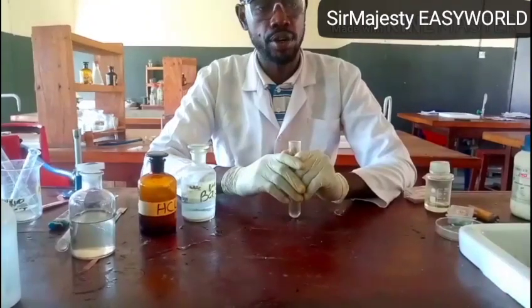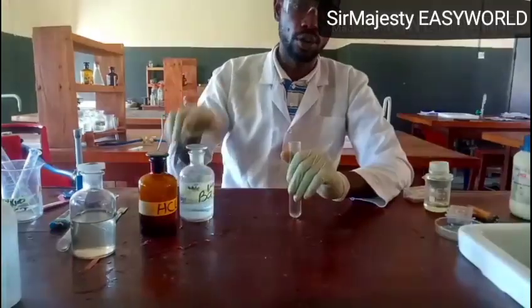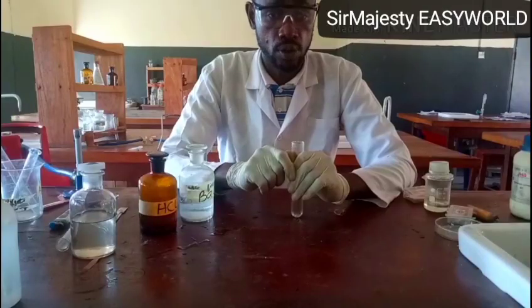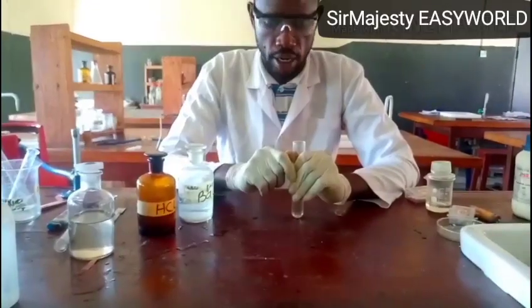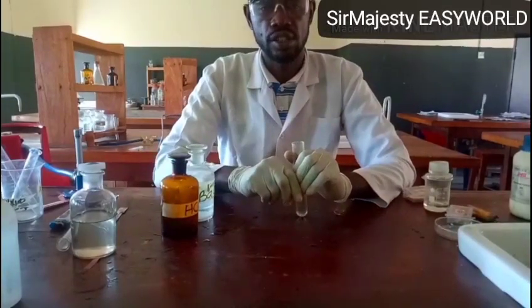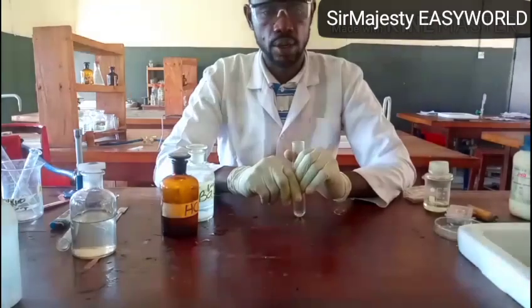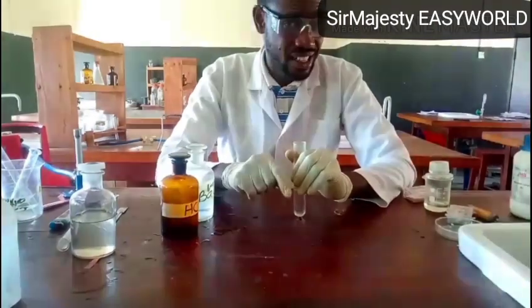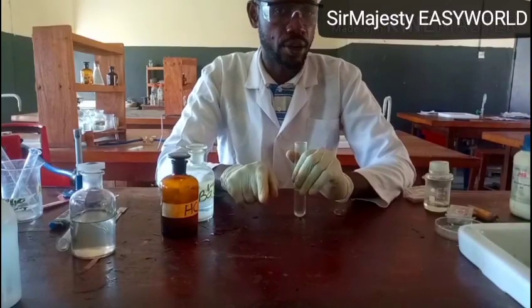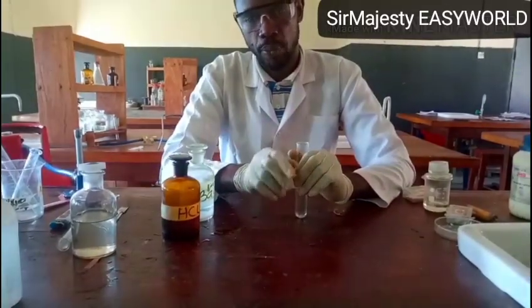What we got here is that on adding barium chloride, there was a white precipitate. And I told you, if you add barium chloride to a solution of an unknown sample, the formation of a white precipitate indicates the presence of SO4 2-, SO3 2-, or CO3 2-. Then on adding excess dilute acid, it will pick the one that is present. Sorry, it is only SO3 2- and CO3 2- that dissolve in excess dilute HCl. So that's the proper test.